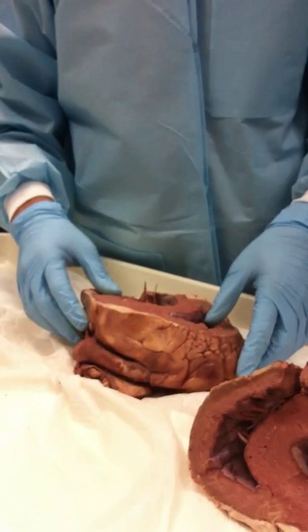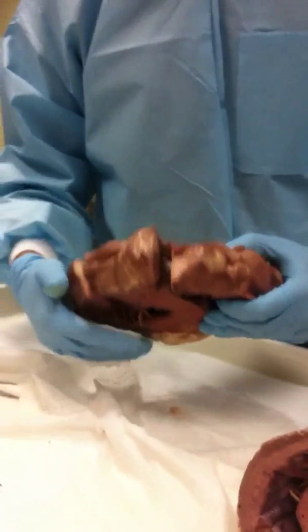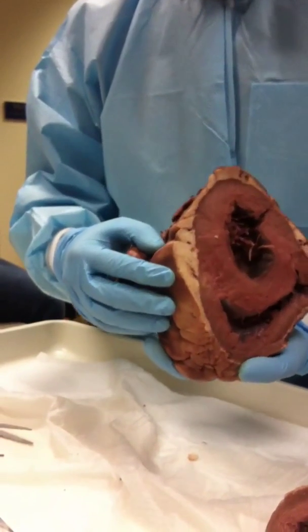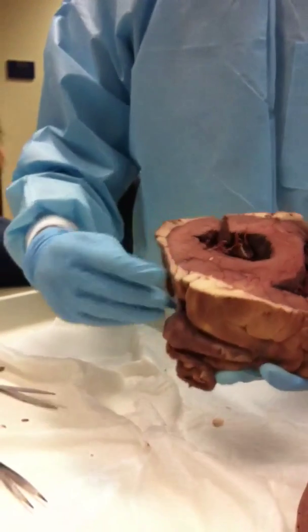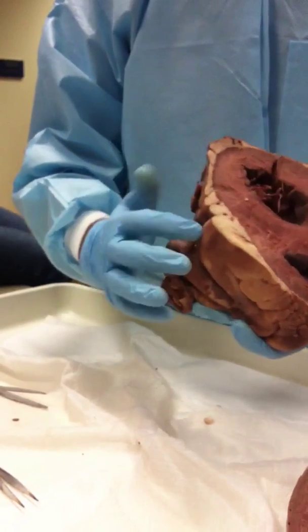So, 17-year-old having a heart attack, you would think that. So what was in the fat again with the arteries? What was that? Well, we don't have the pericardium here. The pericardium has been removed, but we have the coronary arteries here. And this fat is heavily calcified. I mean, it's like a rock.